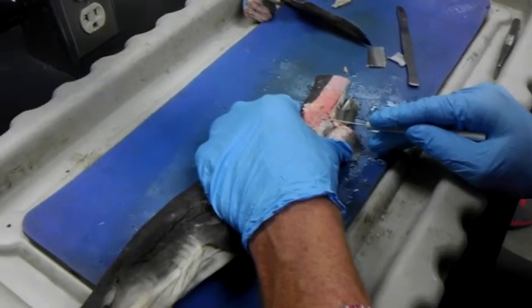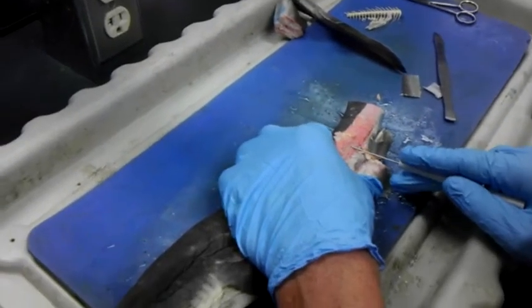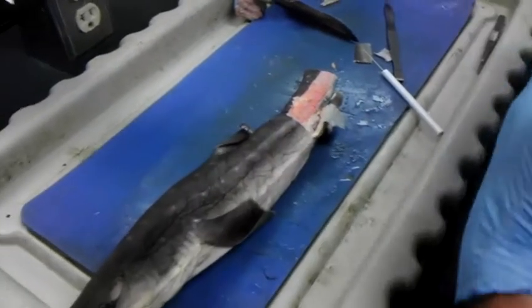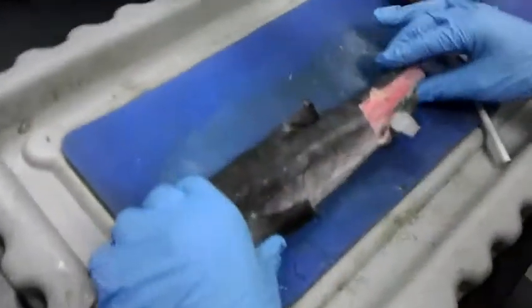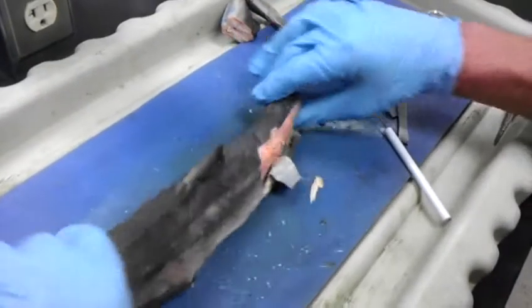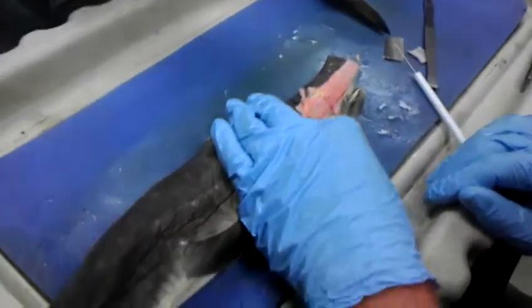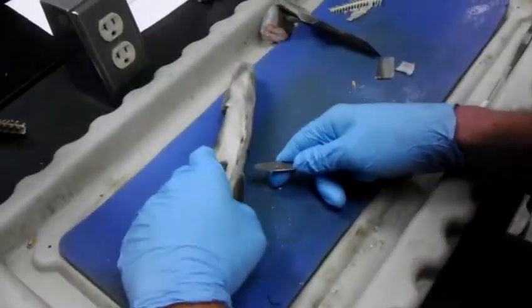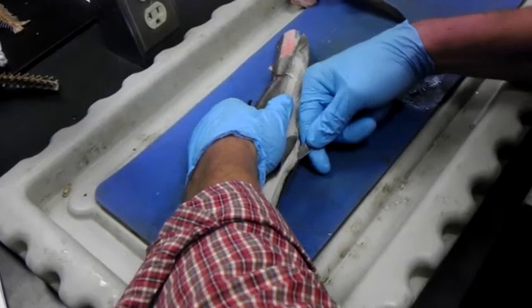Myotome plus myoseptum makes up the unit called a myomere. Okay? And so the significance of these muscle fibers going this direction is that when this is working, these fibers are sliding on one another. They're bracing up against the myoseptum, so it bends it this way and bends it that way. It's working, it's relaxing. Everybody good with the muscles? And you can see all of those easily on a fresh specimen as well.